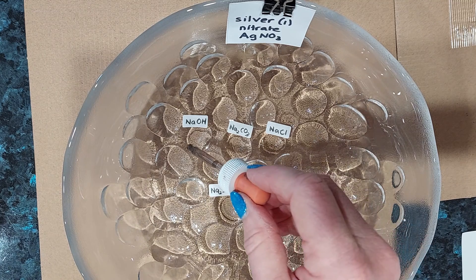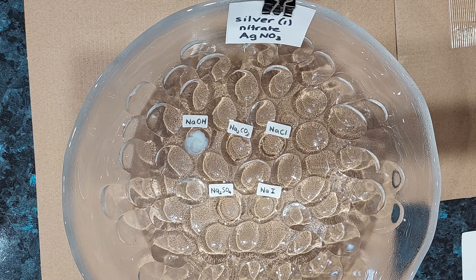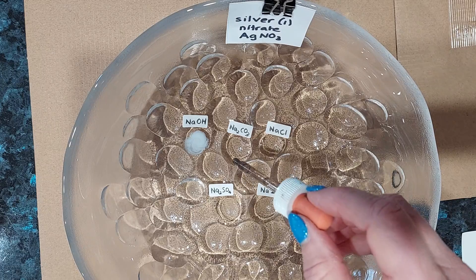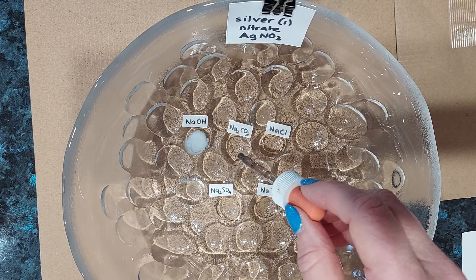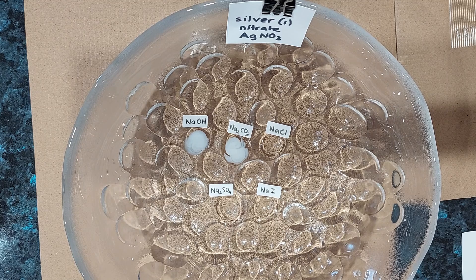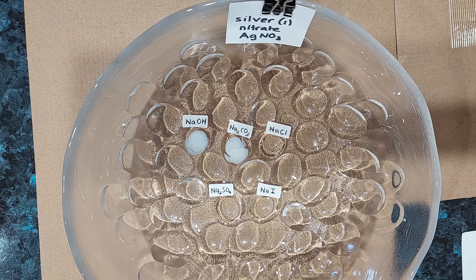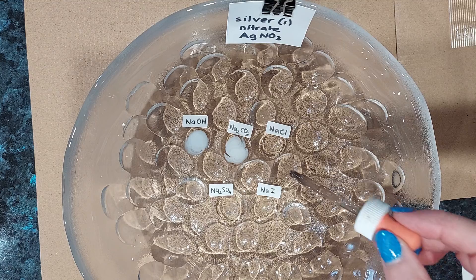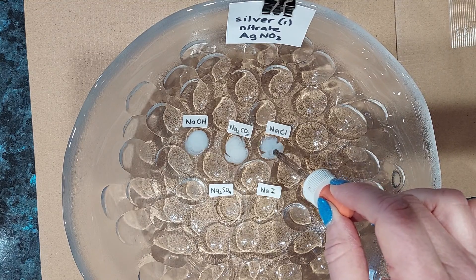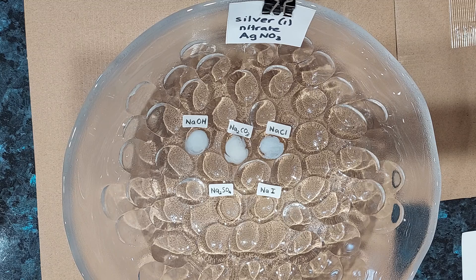So this is silver nitrate and sodium hydroxide — we can see immediately that a white solid formed. Sodium carbonate and silver nitrate — again we have a white solid. Let's try silver nitrate with sodium chloride — again we've made a precipitate, a white solid.